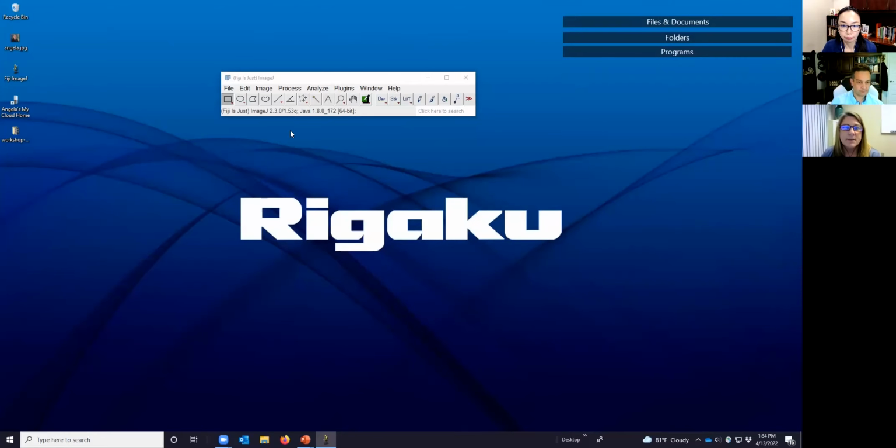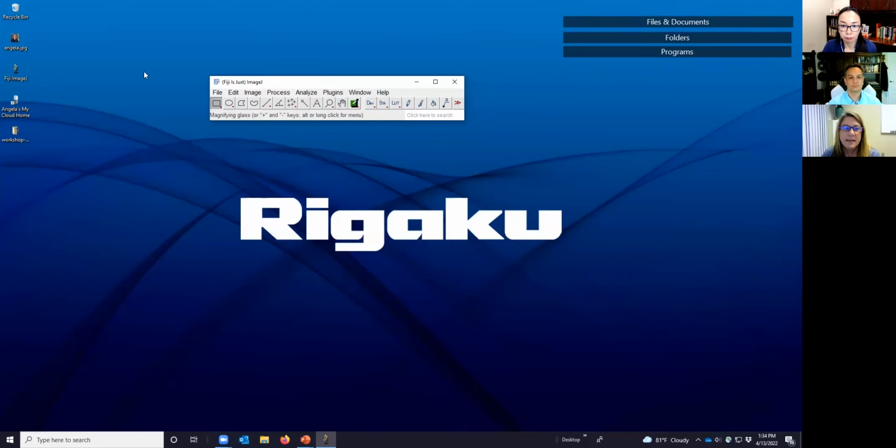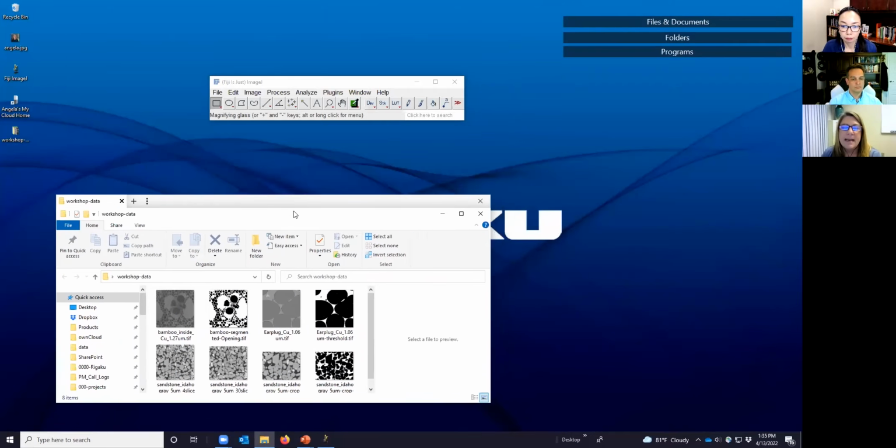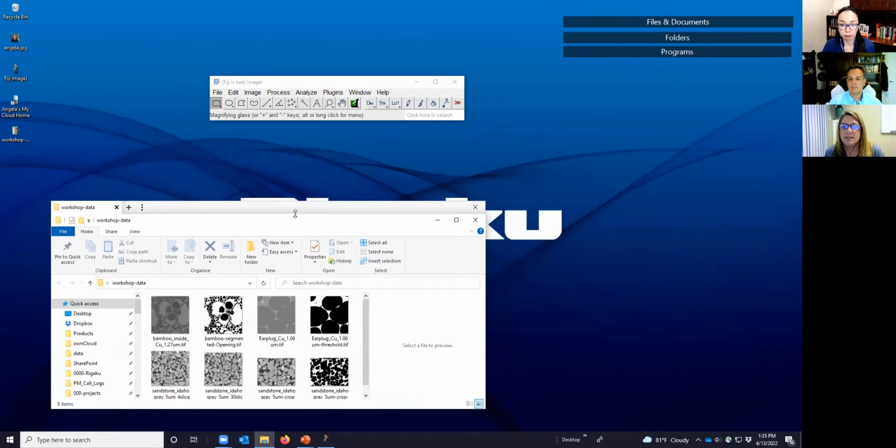Okay. All right, so again, hopefully you should see my blue screen. I'm going to open a folder that contains our workshop examples. One of the things I want to mention today is that we're going to look at binary images specifically because we're refining segmentation results. But in fact, you can use this for grayscale images. So in the data folder, I've included the original grayscale images from which the segmentation was done, so you can play with those and see how it's different.